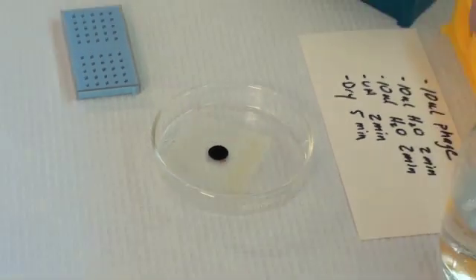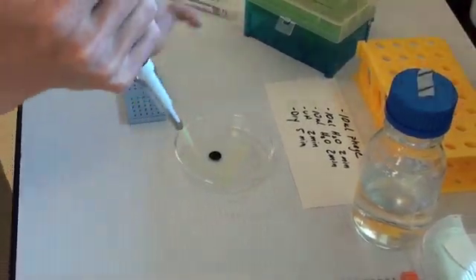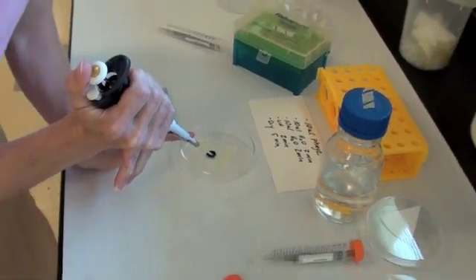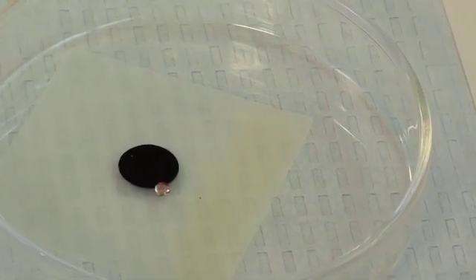Here we'll watch as liquid is added to the TEM grid. In this case, we're adding the sterile water. You'll notice that the protocol is available. The sterile water is added and allowed to sit for the specified amount of time.